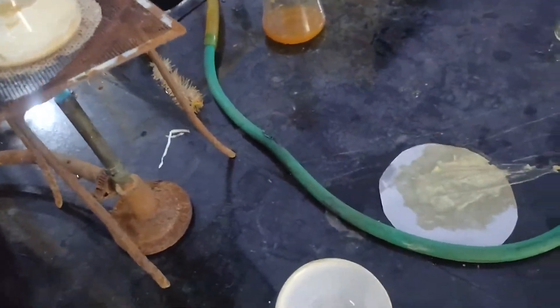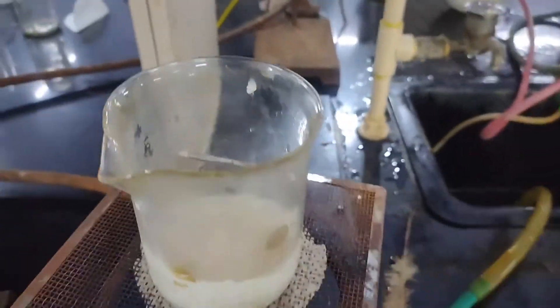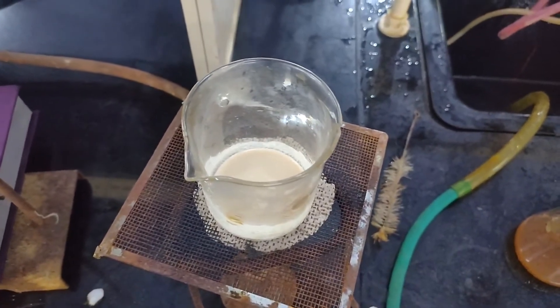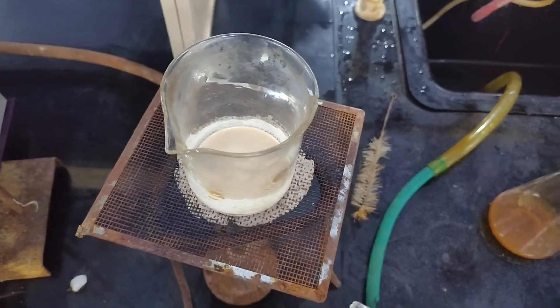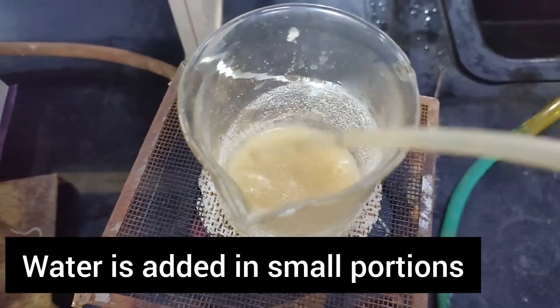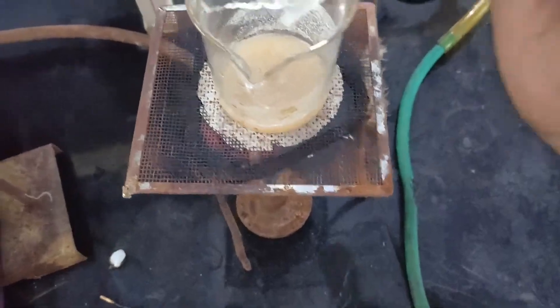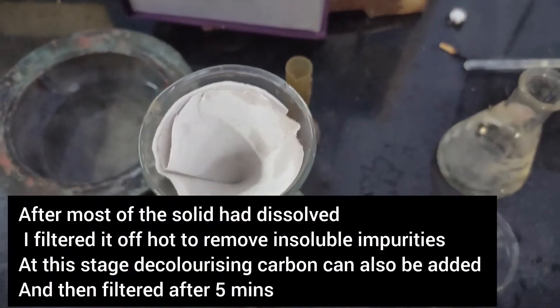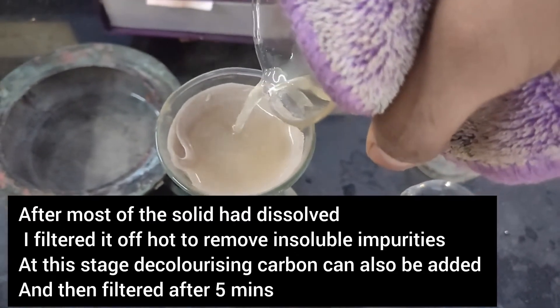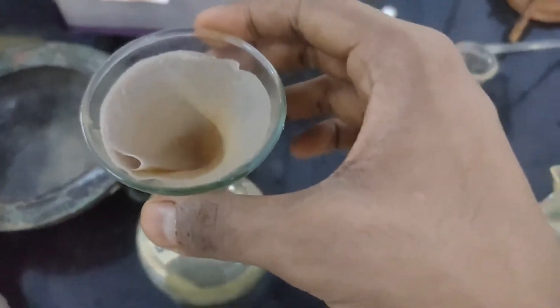More water was added to dissolve the benzilic acid. When the solution started boiling, water was added in small portions just to dissolve the benzilic acid. When most of the solids had dissolved, the solution was filtered to remove insoluble impurities. Before filtering, you could also add decolorizing carbon.